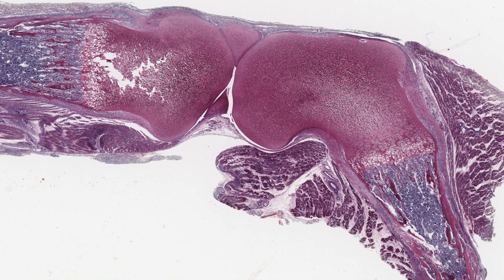This is a section of a newborn knee joint, stained with the periodic acid Schiff reagent, or PAS, for carbohydrate to emphasize the matrix of cartilage and bone. Cartilage appears an intense magenta. That which is calcified is even darker. Bone tissue, down here, stains paler because it's got much less carbohydrate, and the cells stain very poorly.